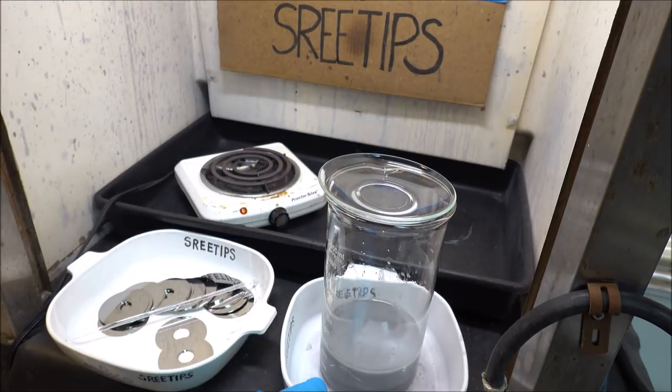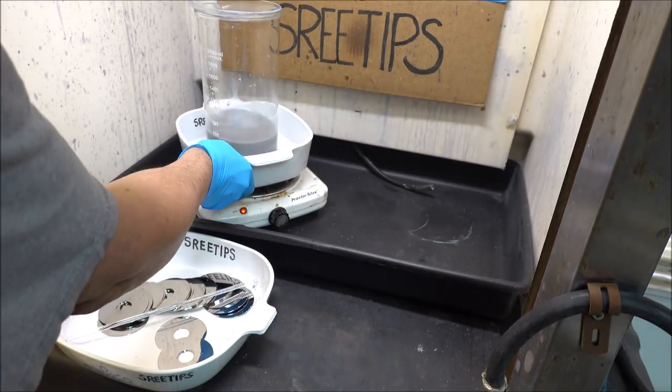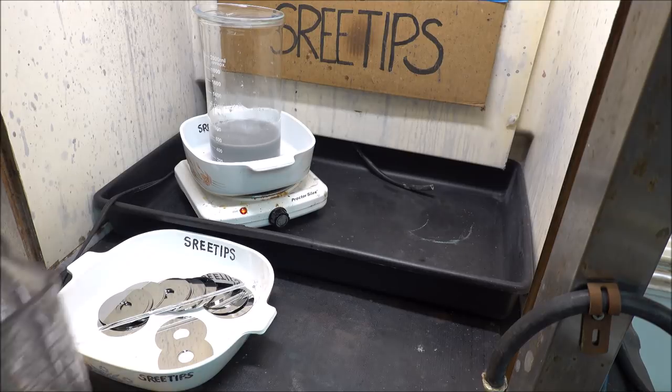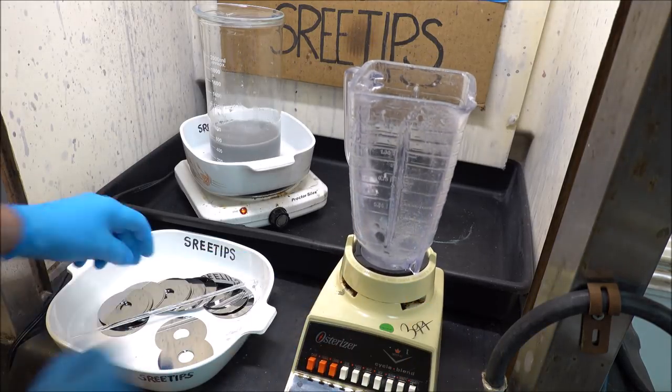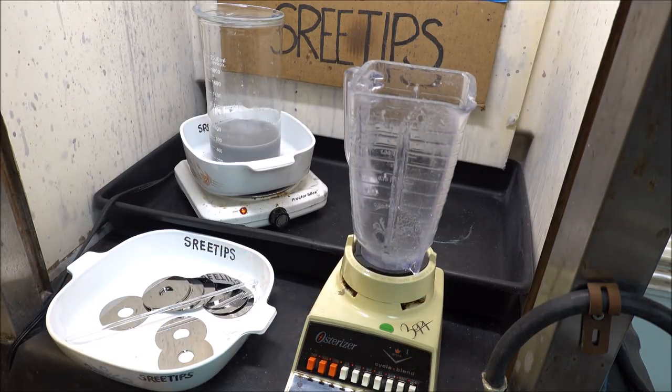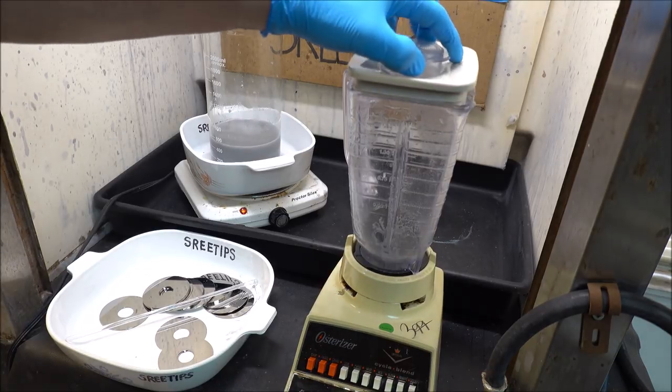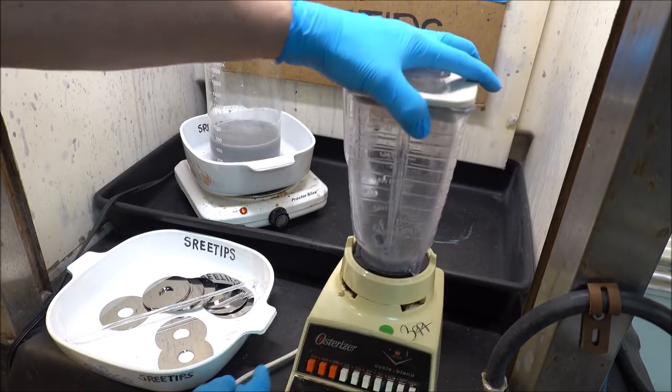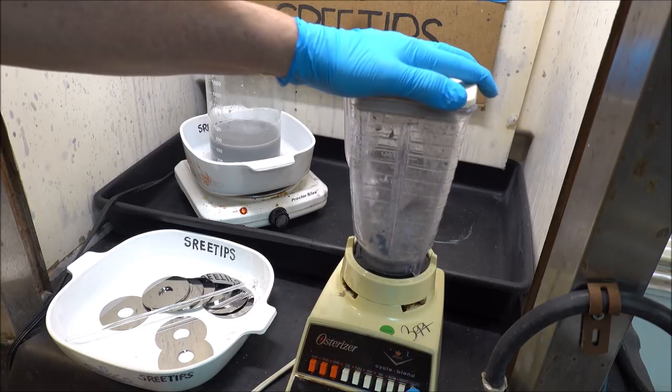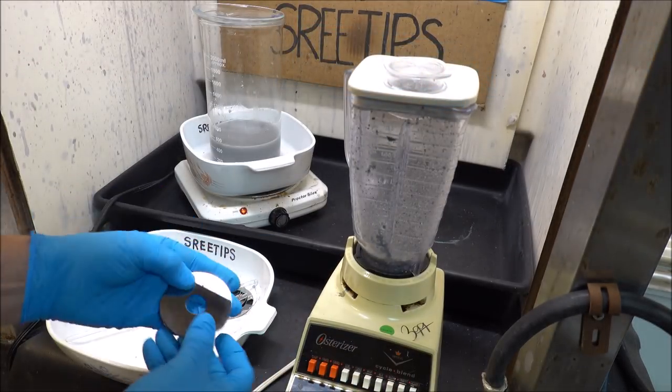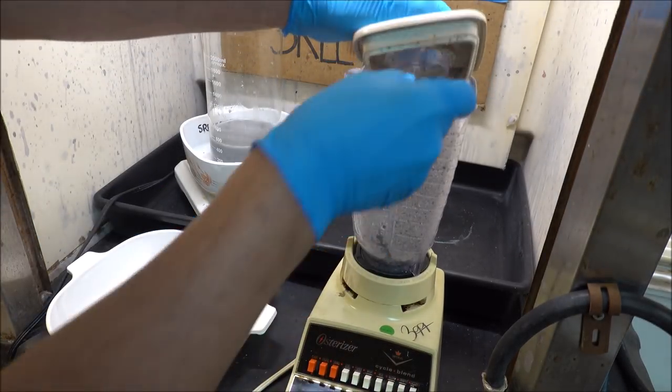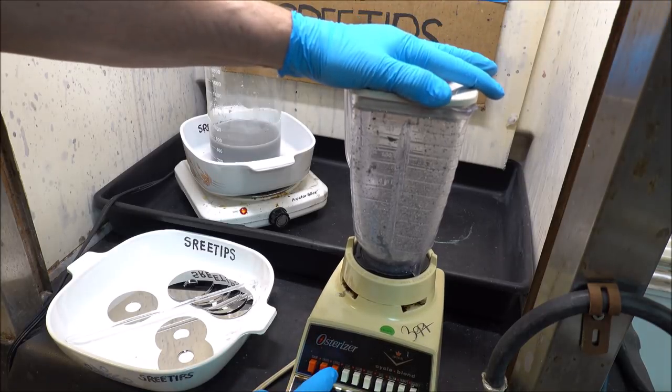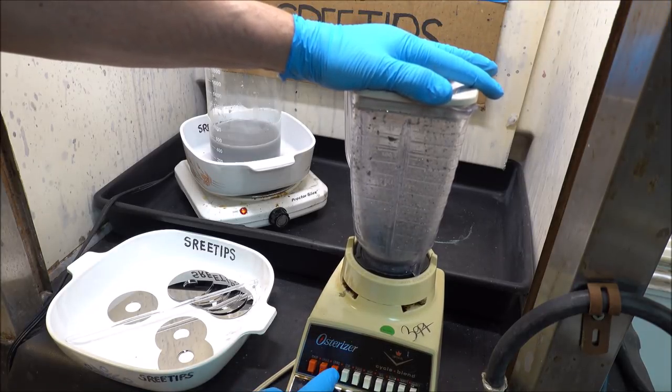Get our blender back down here and add a few more disks. Keep going with this until I get it all ground up. Now that this thing's been emptied out and there's some room in there, it's looking pretty good here.